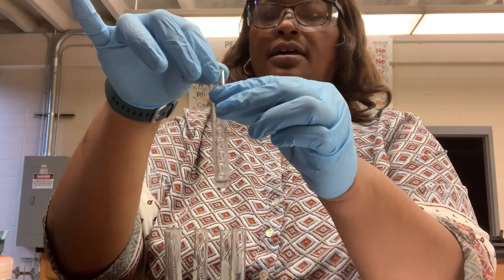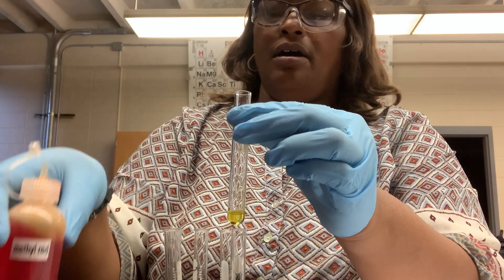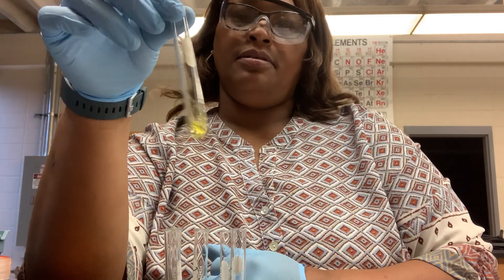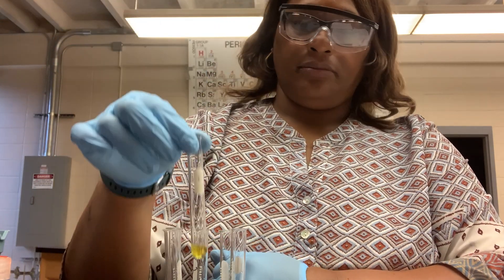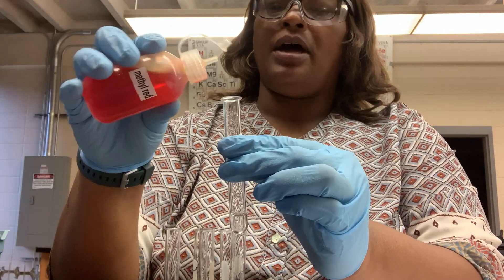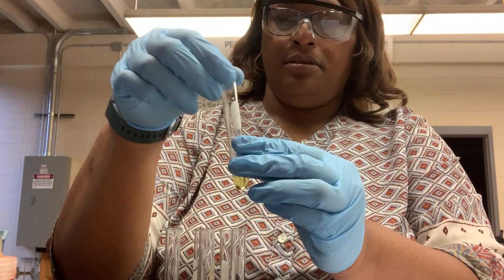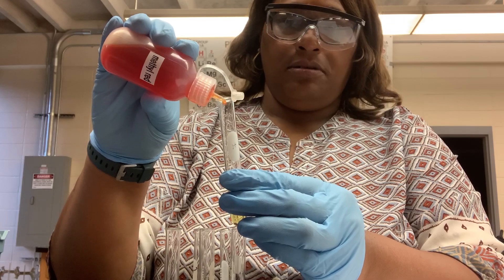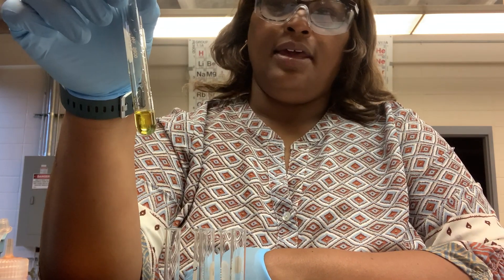Next is the ammonia. I'll put two or three drops of the methyl red in the ammonia, and we note the color. And then finally, the club soda — again, two to three drops of methyl red, and we note the color.